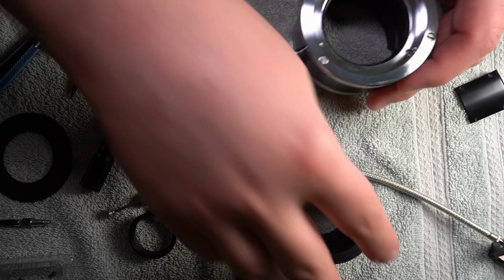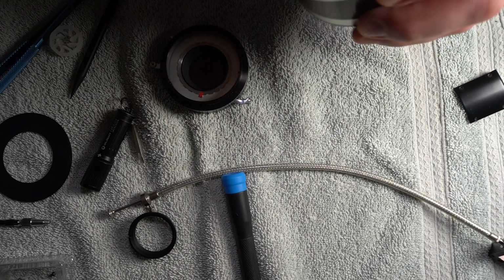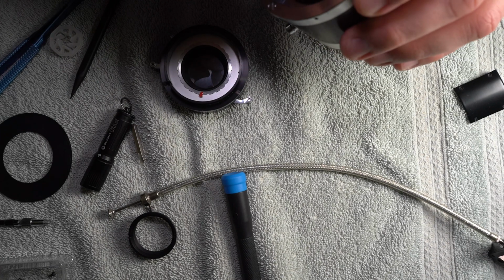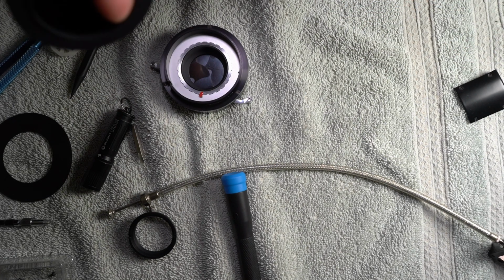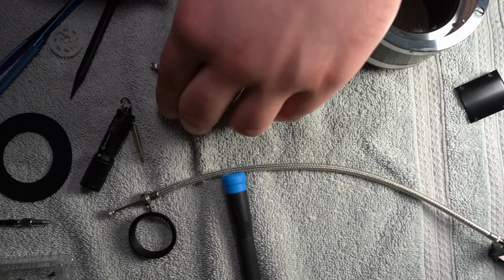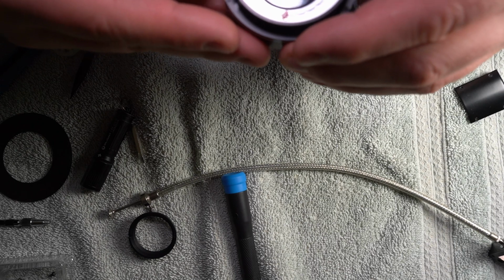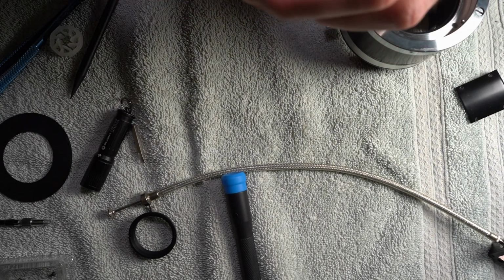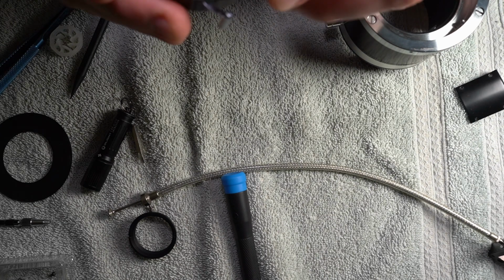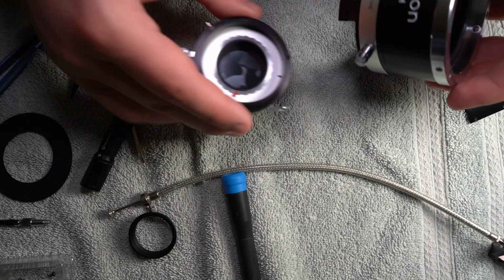I'm going to put this in the way that it came, in fact, the opposite way of what it did when it came out. There's not really any major movement. Oh, shoot, I shouldn't have done that. Got to figure out what setting this is on now. Okay, that's on bulb. Or, no, that's not on bulb. That's the other one. Okay, that's that extreme.